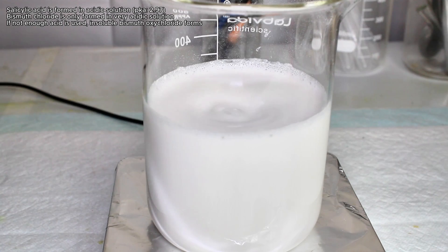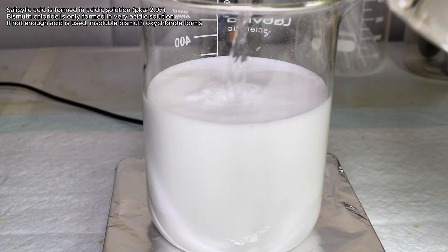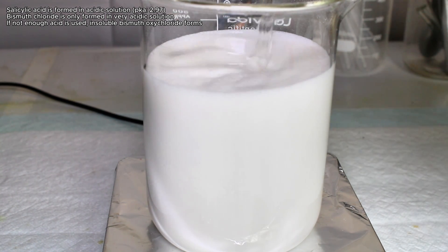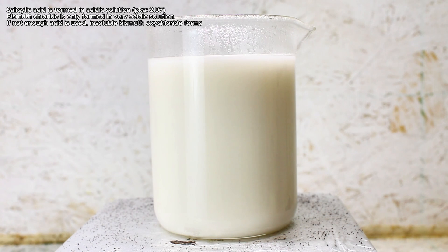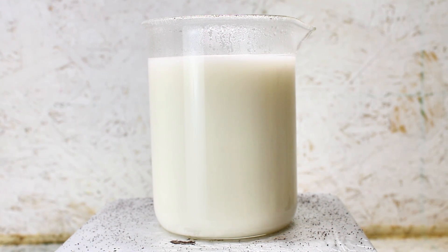The reason I used such a strong solution is that making it too weak will result in formation of insoluble bismuth oxychloride, which again is what happens in your relatively weak stomach acid. I left this on my hot plate under constant stirring and a bit of heat, and after about 30 minutes the bismuth was probably completely dissolved.